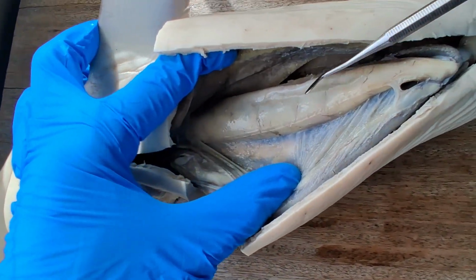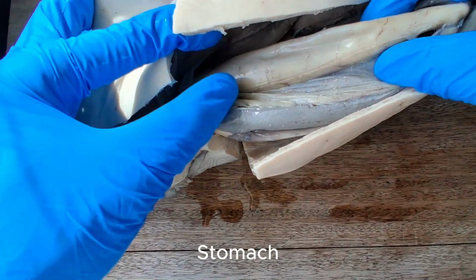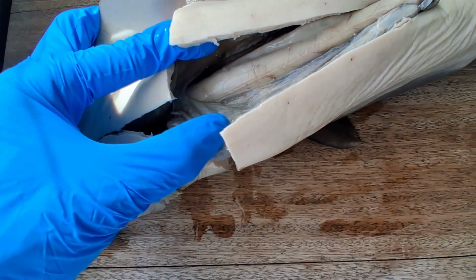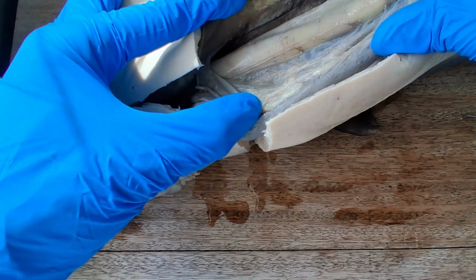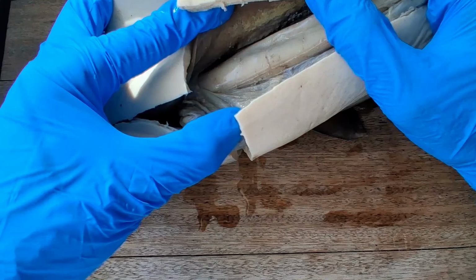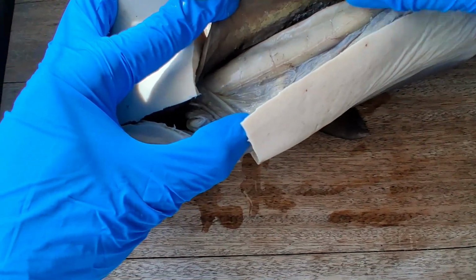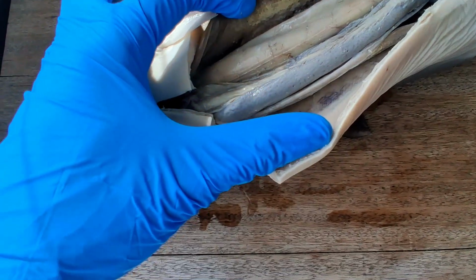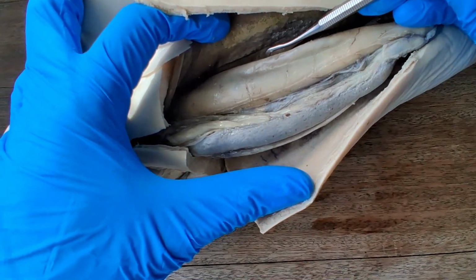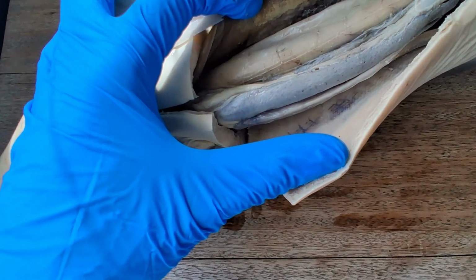Okay. This one is the stomach. It is continuous with the esophagus up there, but unlike in the rabbit or in tetrapods in general, there's no clear external demarcation between the esophagus and stomach. You cannot simply base it on size because they have roughly the same diameter. Instead, you can differentiate the esophagus from the stomach based on histological characteristics.